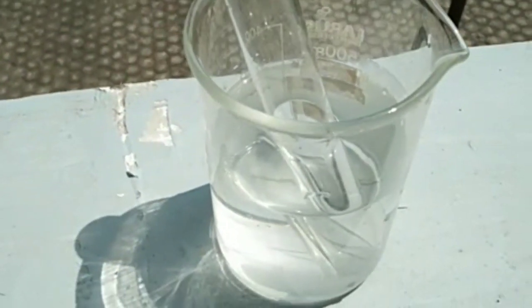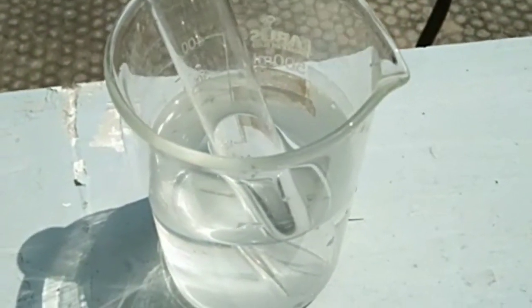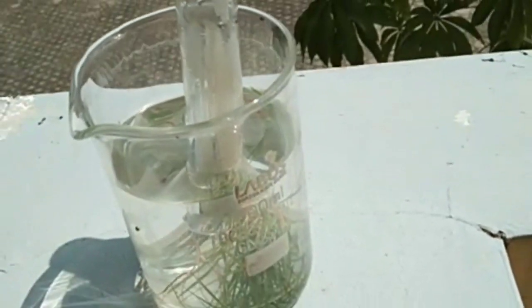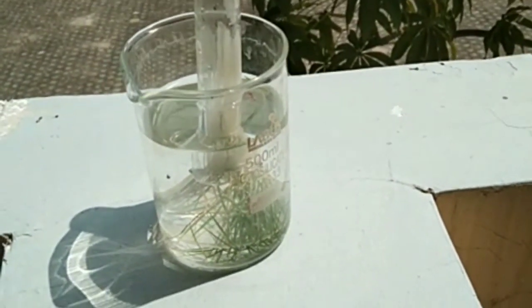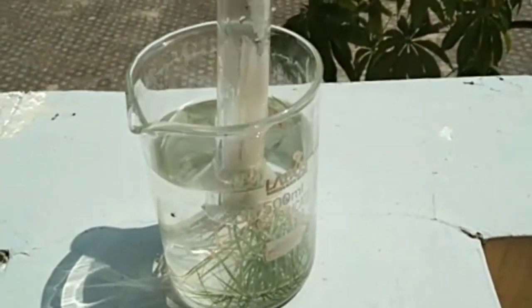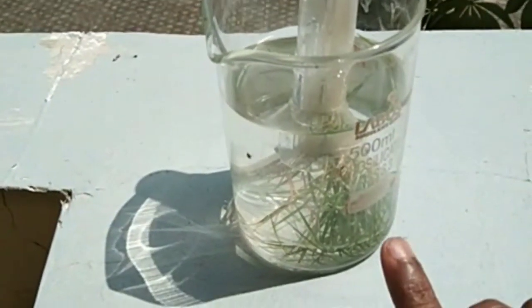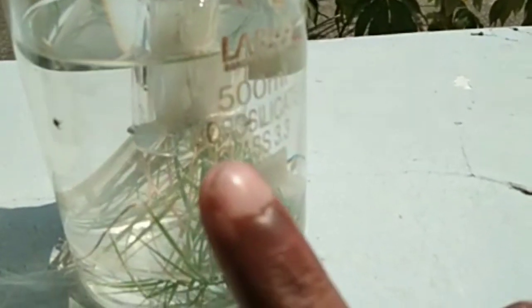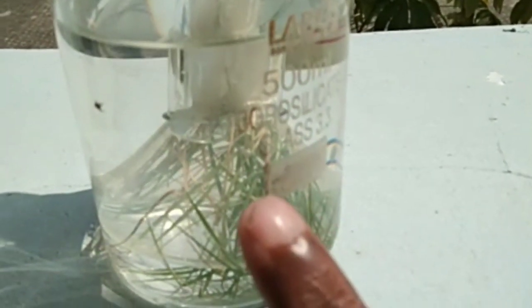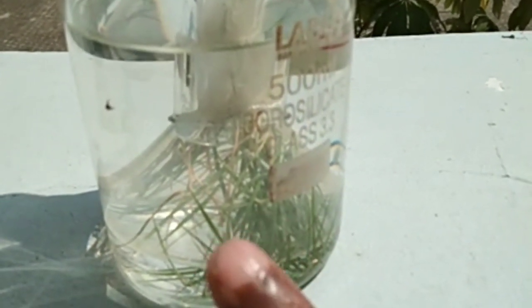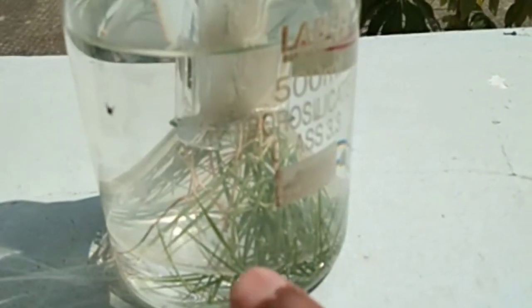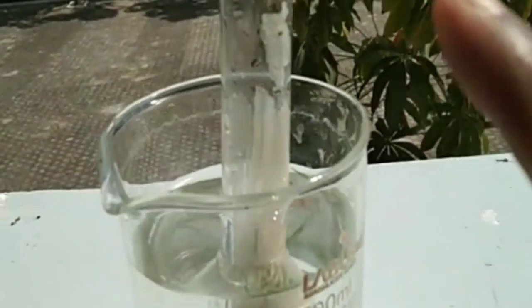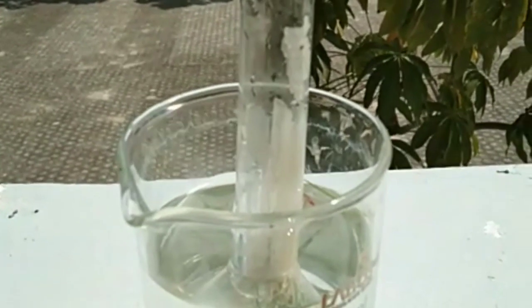After that, you can see the grass plant is inside. There you can see now. Very good, great observation. There is a funnel, then water inside with the grass plant, and one more test tube also is there.